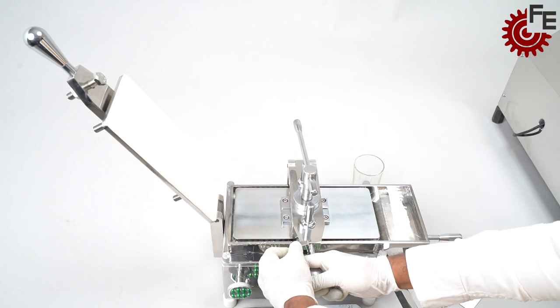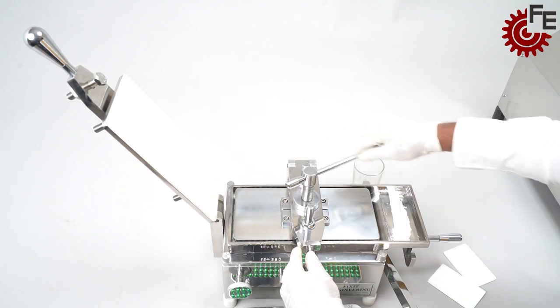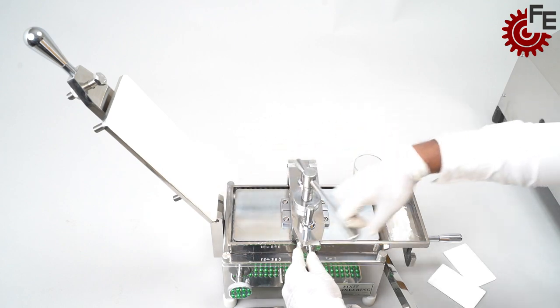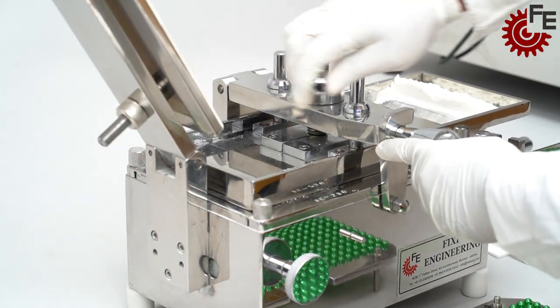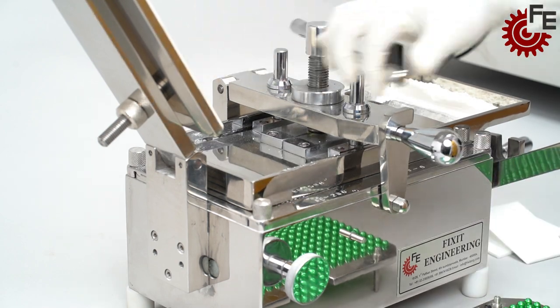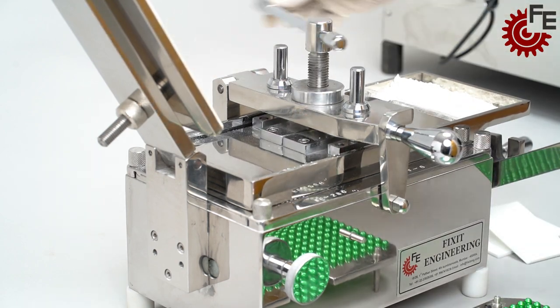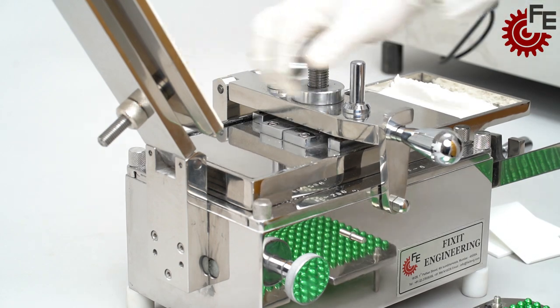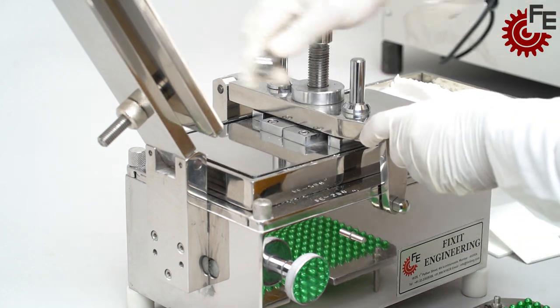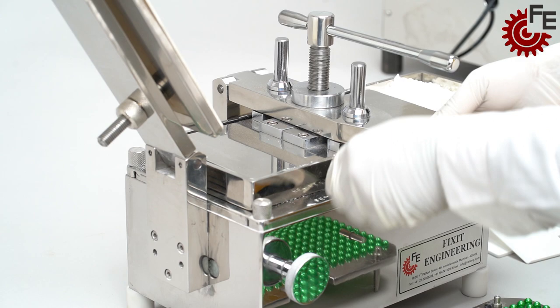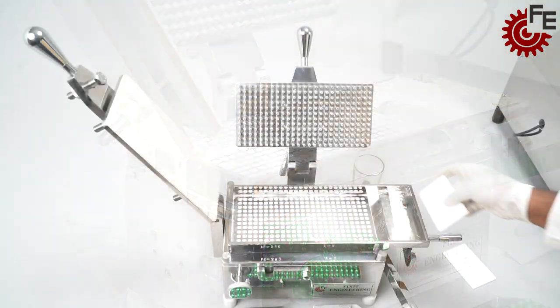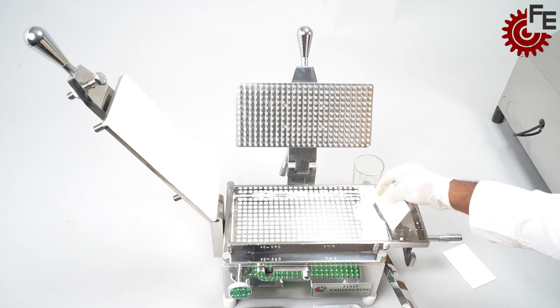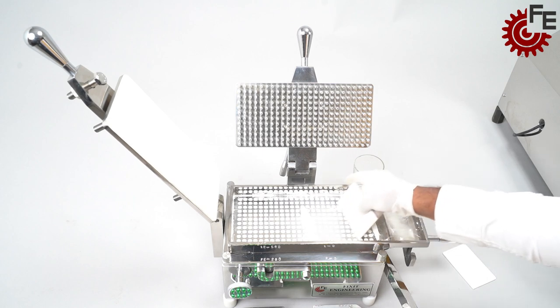Perform the tamping operation. It compresses the powder and makes space for more powder to fill. Repeat the process until your desired formulation powder gets filled.